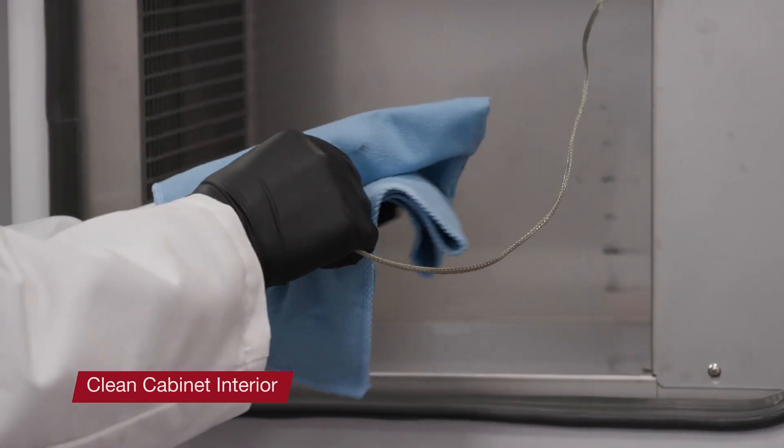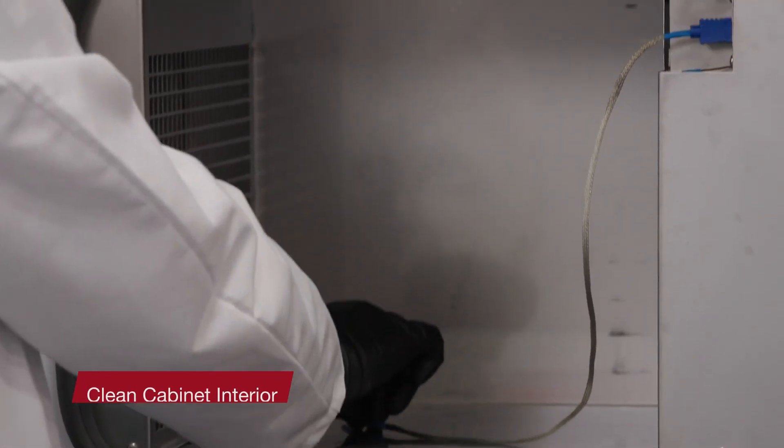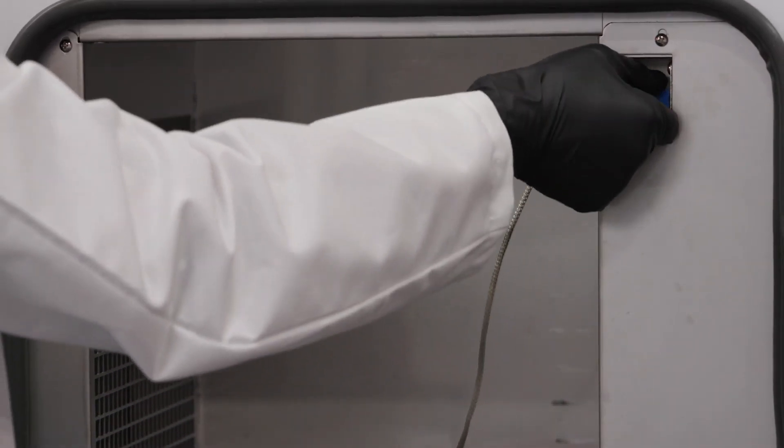Clean the sample probe with alcohol and allow to dry. Unplug and remove the sample probe from the chamber.